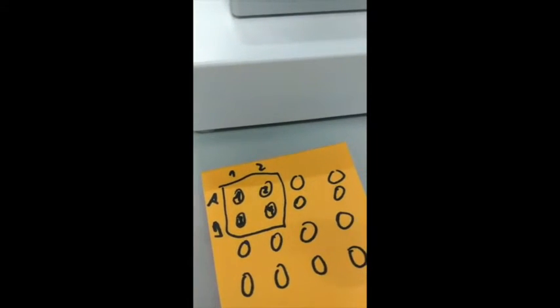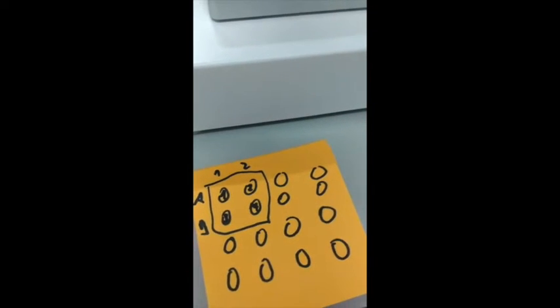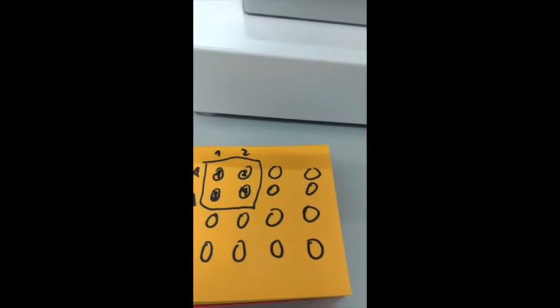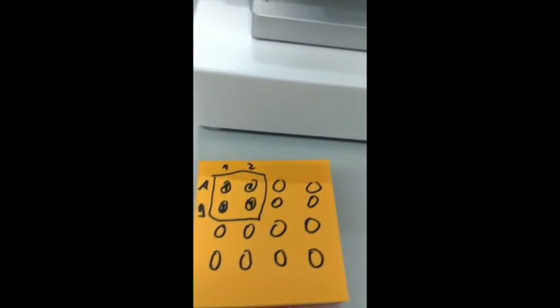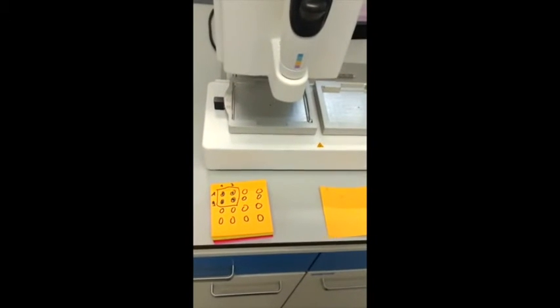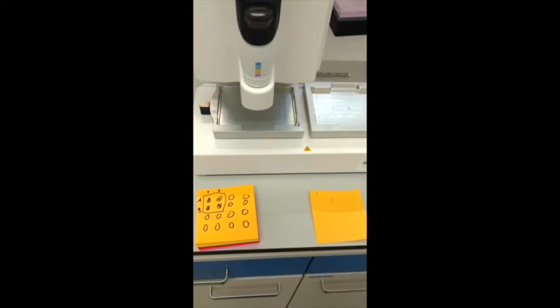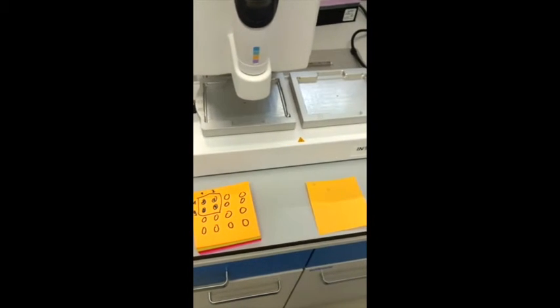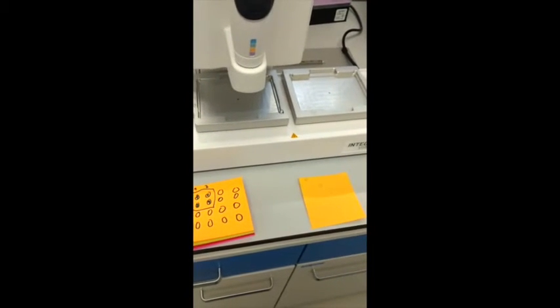So you just enter the patients' IDs or sample names and how you are going to track them only once into an Excel sheet, and on a different sheet you'll get them in schematic form, the 384 scheme, that you can also save and load into the QuantStudio software, so that is basically not a big deal. You can either do that manually, of course you need a steady hand and need to concentrate a little bit.